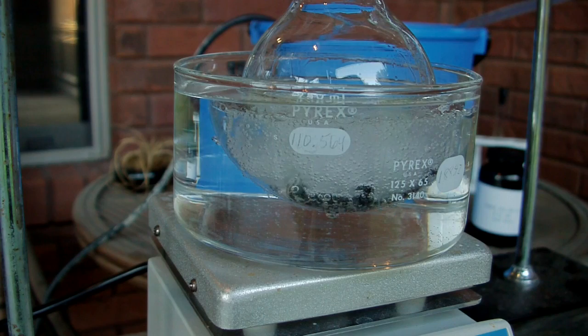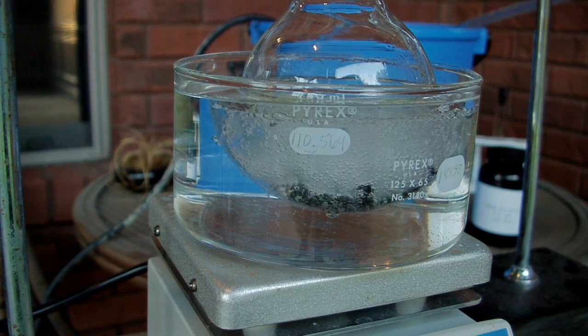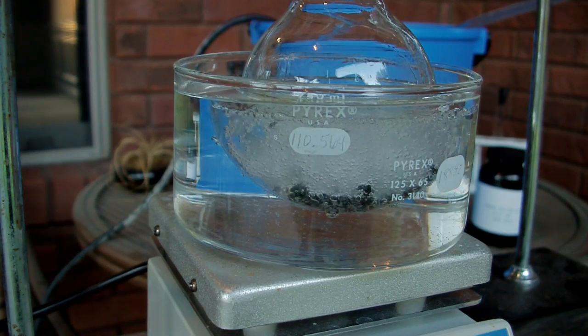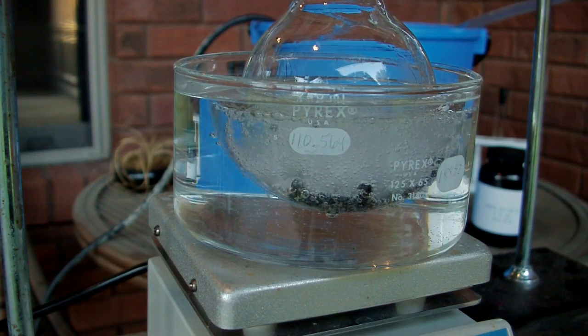If you get two solvents that are very close to each other in boiling points then you need a fractionating column and you have to go to fractional distillation which is a bit more complicated and I don't have a fractionating column. So we'll hope that this will work out.